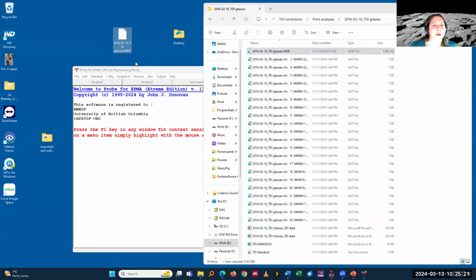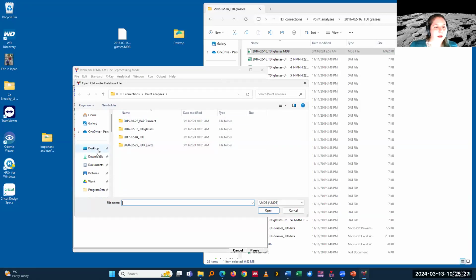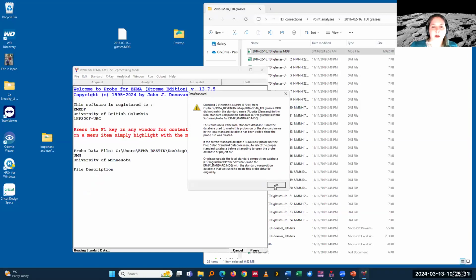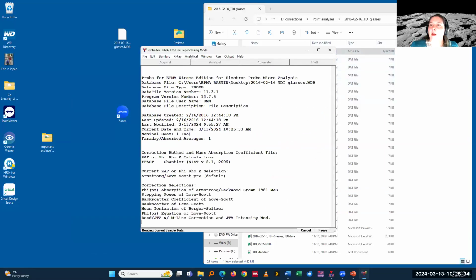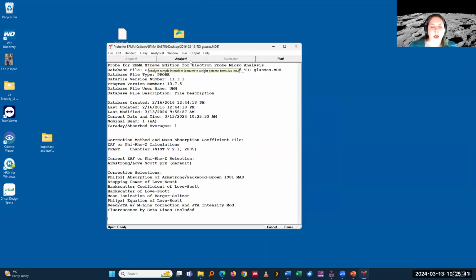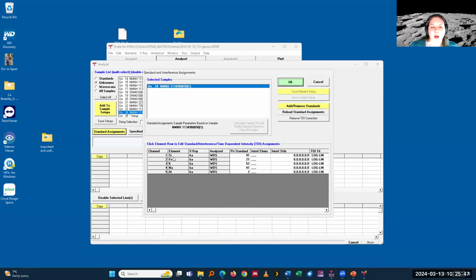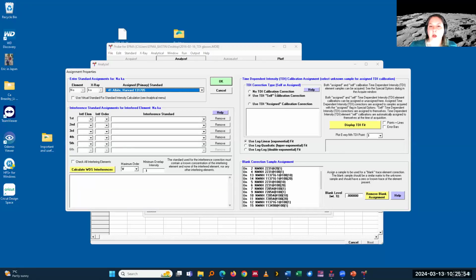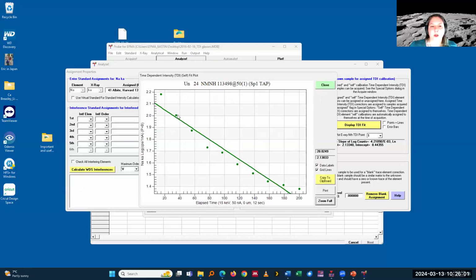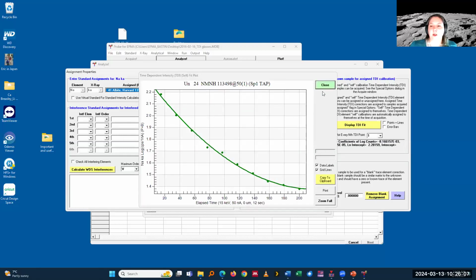It's the MDB. Good. So now there are two places where you can look at your TDI curves. One is simply in the Analyze window when you go into standard assignments and click on the respective element. For all the analysis under this unknown, I can just here on the right-hand side look at and assign display TDI fits or not. So I can switch between different types of fits and can look at it.